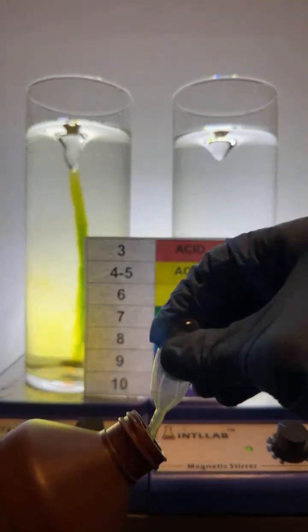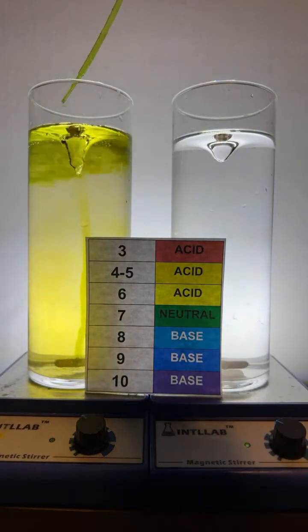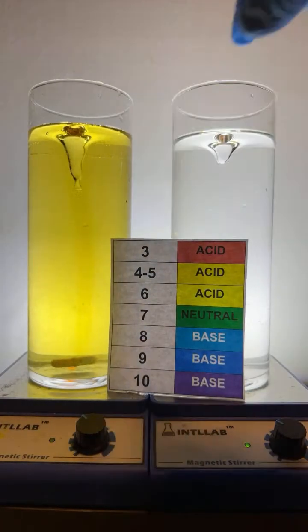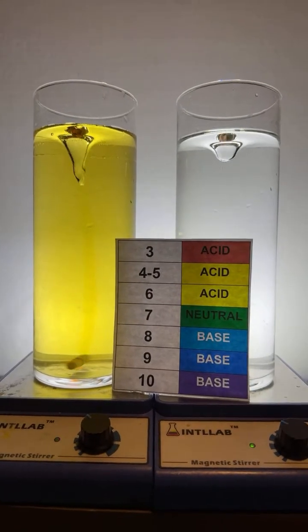But as it continues to interact with the water, we see it develops a yellow color, indicating that it is slightly acidic. And I'm used to that. I mean, it is surprising to some people to see that distilled or deionized water is slightly acidic. But that's very common. It's known by chemists. Any water that's exposed to the atmosphere is going to have carbon dioxide dissolved in it. And when carbon dioxide dissolves in water, it makes the water slightly acidic.